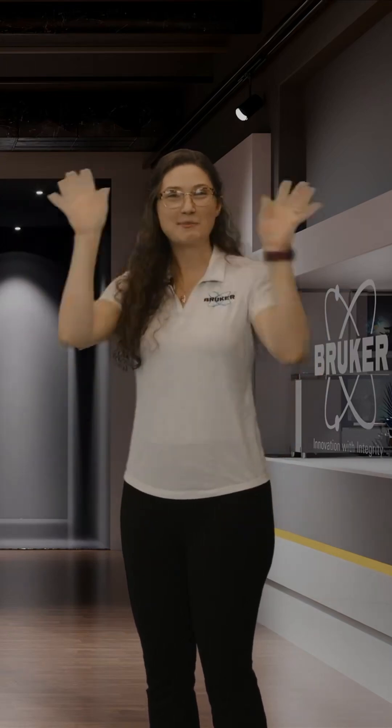Hi everyone! Welcome to APEX, the more you know. I'm Ashley the App Scientist and today I'm going to show you how the Reciprocal Lattice Viewer can help you choose a better crystal, determine if you have a twin, and identify if you have a modulated structure. How can you do that? I'll walk you through it step by step.